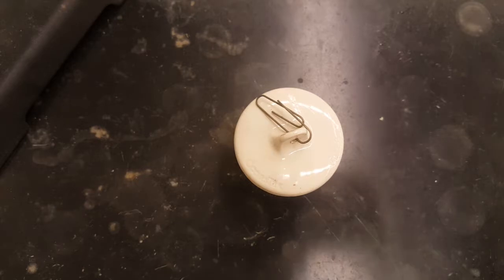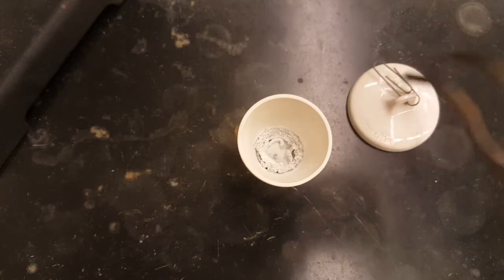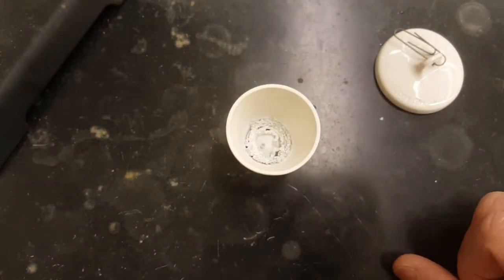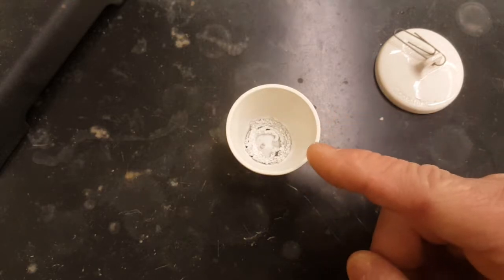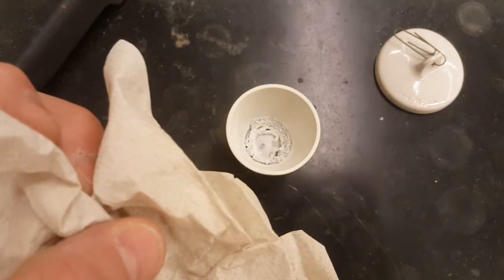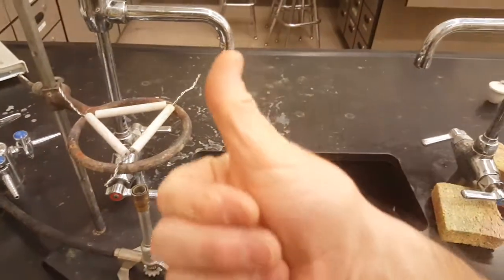Your last step before you do all the calculations that are in the lab is to take the top off and to clean the magnesium oxide out of here. And my crucible is still too hot to touch, so I need to wait. Once it's cool enough to touch, you can dump this in the garbage. This is just ash. And then take your paper towel for next period, wipe out the crucible, place it back on the clay triangle, and next period should be good to go. Thanks everybody, have a good lab.